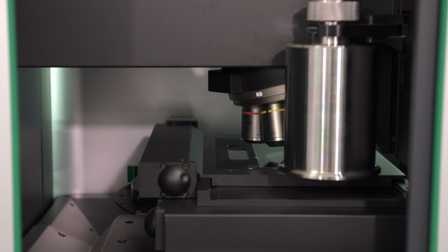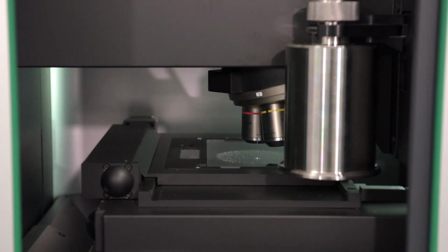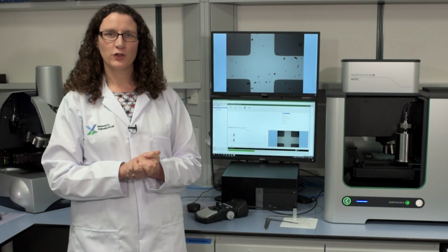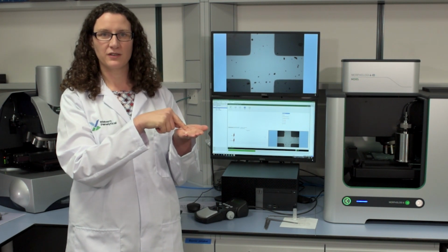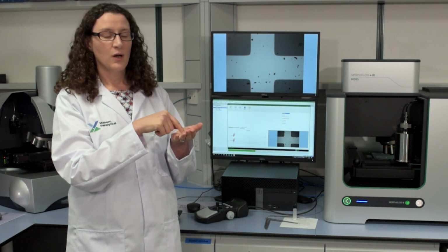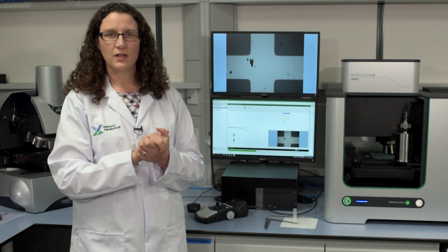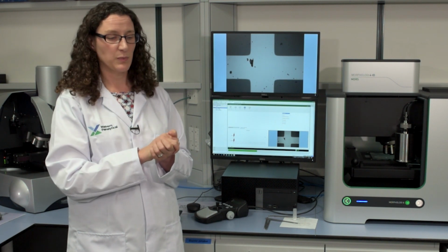The system is now doing a surface find, and it's going to do a little routine that compensates for the tilt of the plate. I'm sure many of you have done microscopy before, and you'll be aware that if you focus on your sample here, and then you move to a different position, you need to focus again. Well, we don't want to spend a lot of time checking the focus, so we use a plate tilt correction routine to correct for any tilt in the plate.